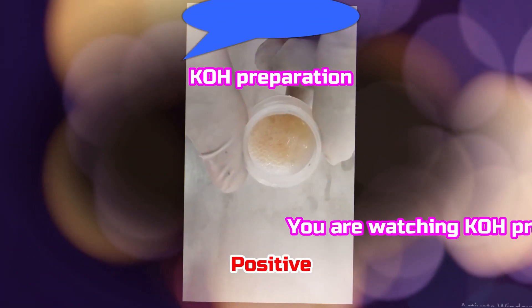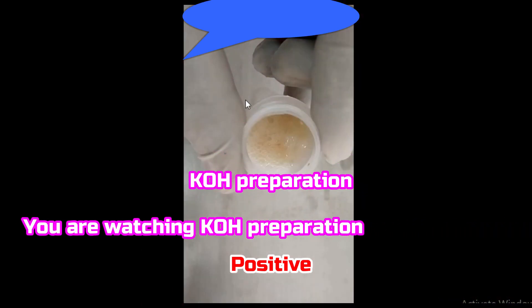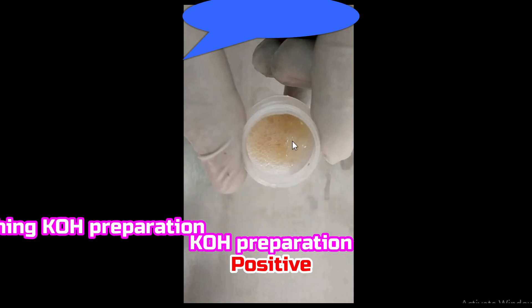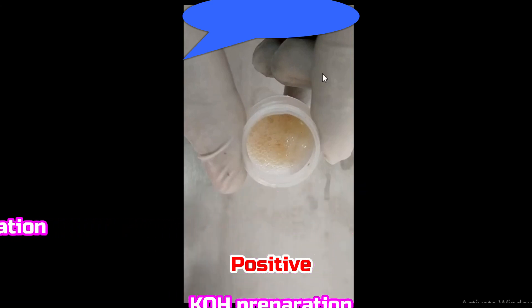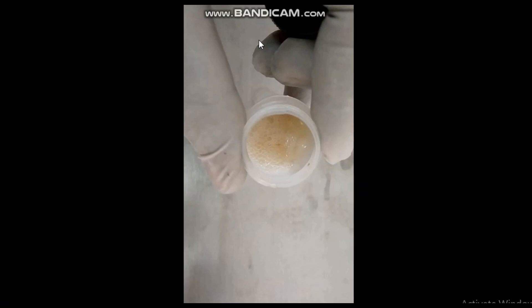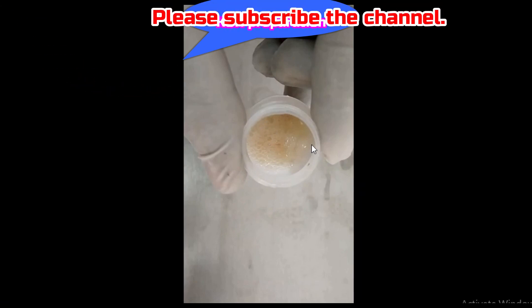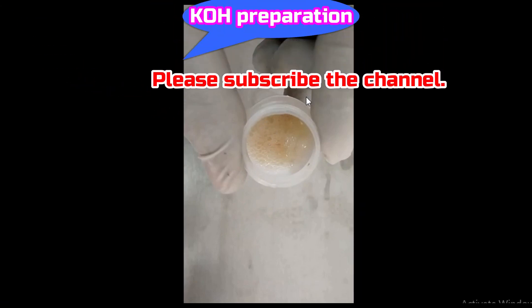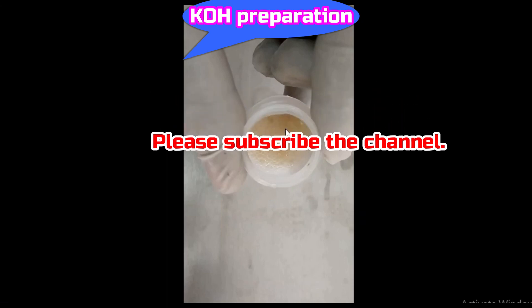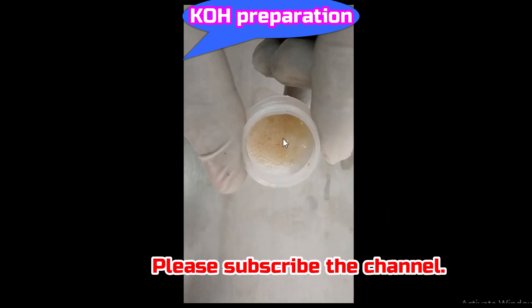Here we have sputum as a specimen, for which we have to perform potassium hydroxide — in brief, KOH preparation. First of all, mix the sputum uniformly with an inoculating loop, then transfer a loopful of sputum onto a slide.